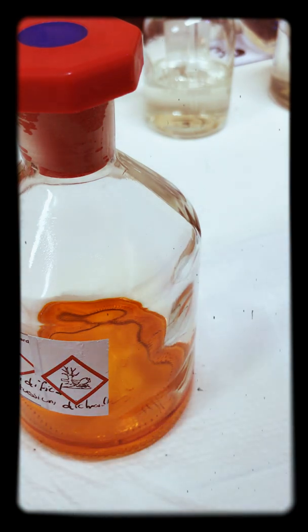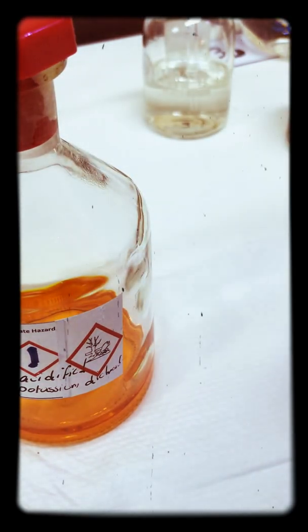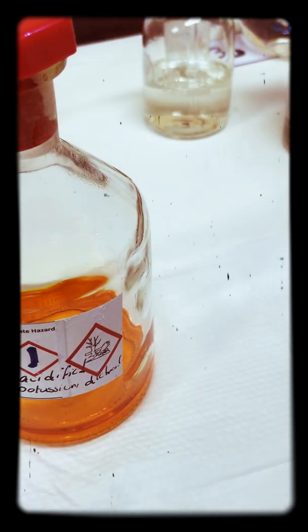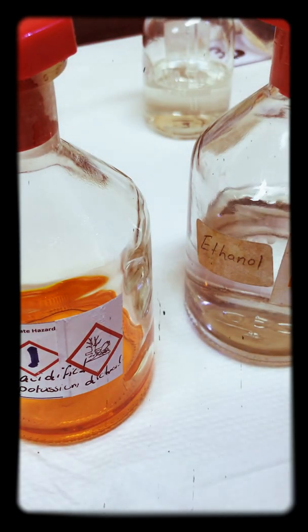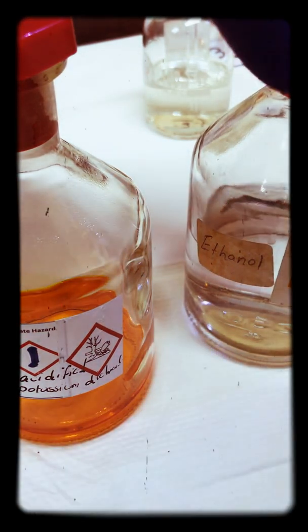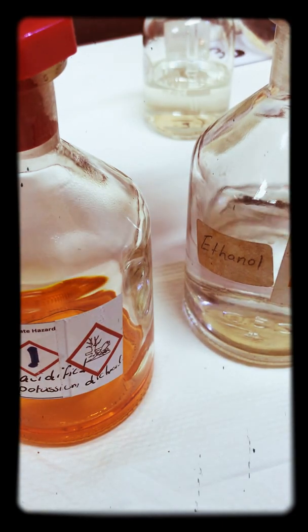To demonstrate this, we're going to use ethanol, which is the active ingredient in hand sanitizer. What we're going to do is just add a little bit of ethanol to a test tube to show you the procedure.